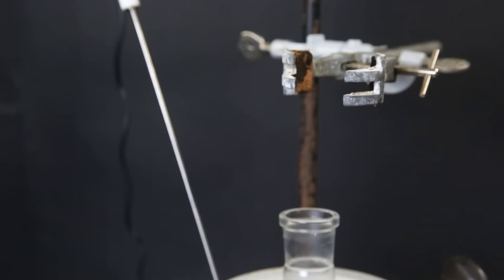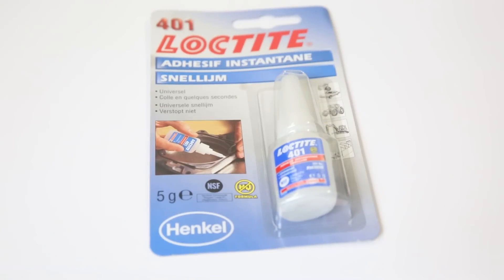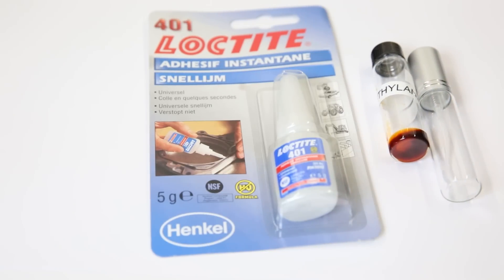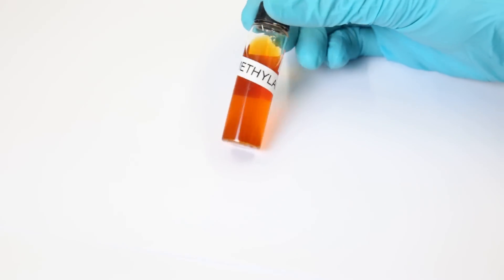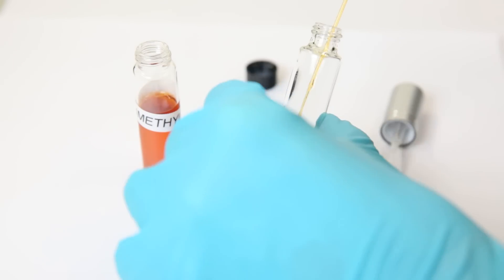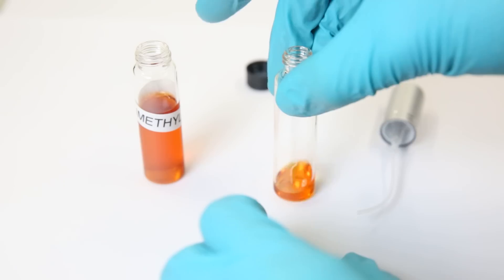But to test it, we can see if it works as a superglue activator. So I went online and bought some cyanoacrylate superglue and spray vials so I can test the activator. Superglue activator is quite a simple product, and it's basically just 4-NN trimethyl aniline dissolved in acetone. So I simply put a bunch of acetone in the vial and shook it around until everything dissolved. After a few minutes of shaking, it had all dissolved, and I can now transfer part of it to the spray vial. Since it doesn't have to be superconcentrated, I transfer only a little bit and top it off with more acetone.